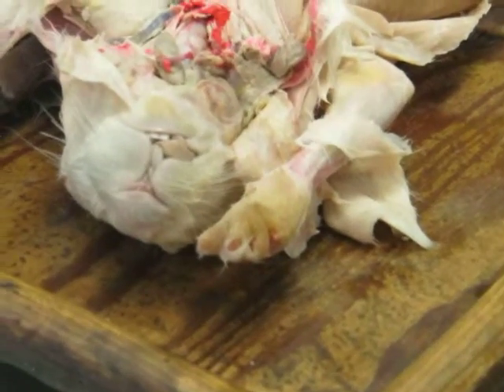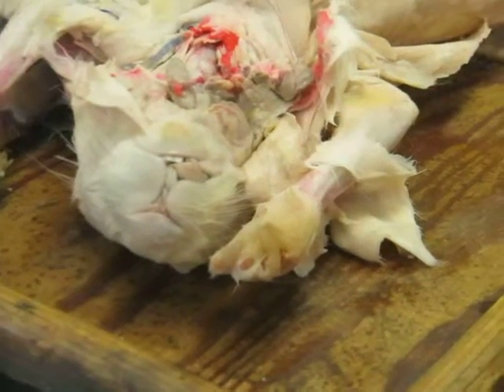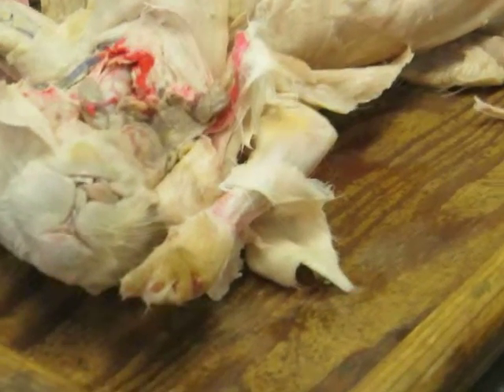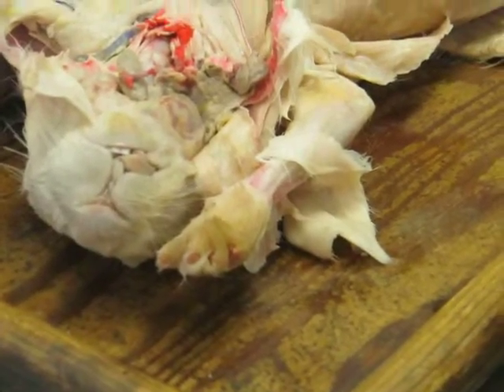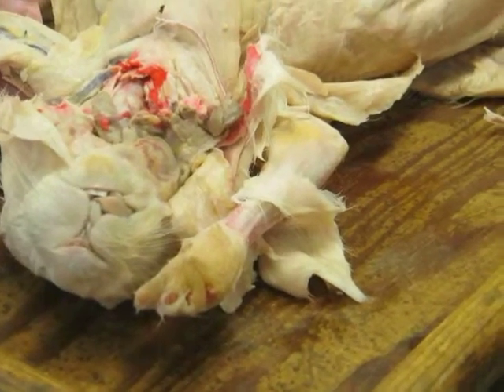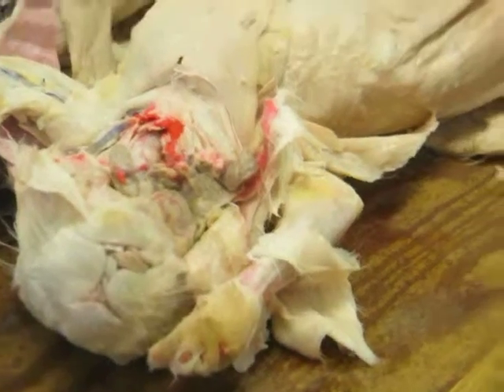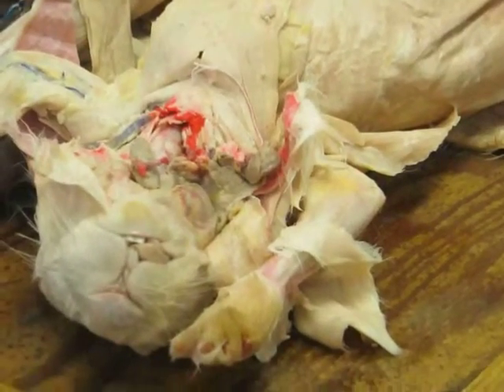That's a unique mammalian feature, by the way. You probably know this, but we alone among all vertebrates really have the ability to move our faces and make expressions because of this hyoid arch musculature that migrates into the face. So, okay, we good? That's all the muscles.